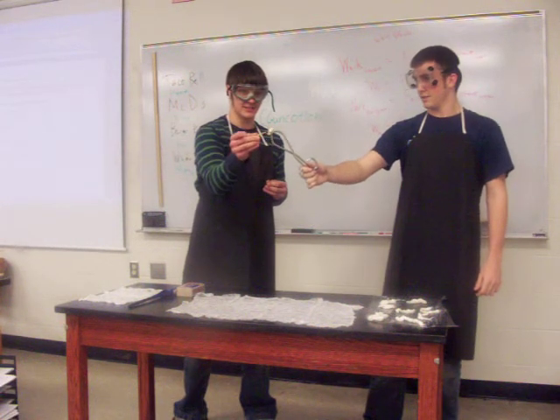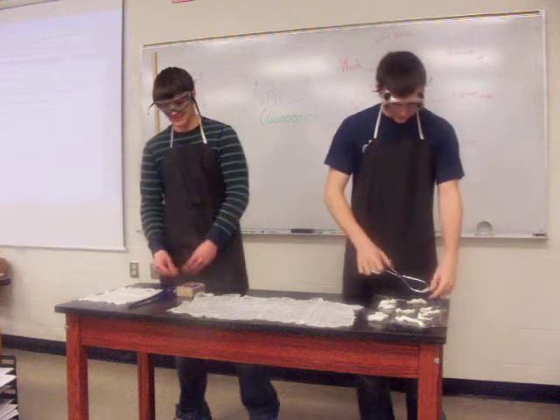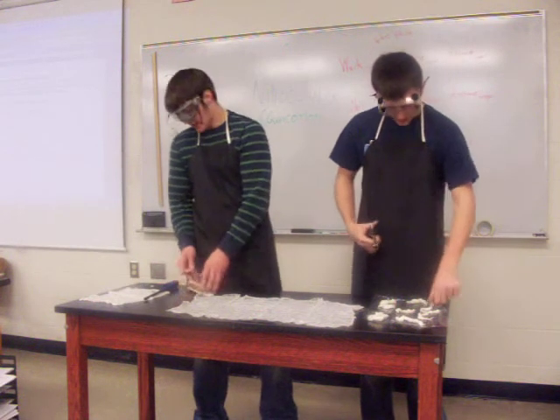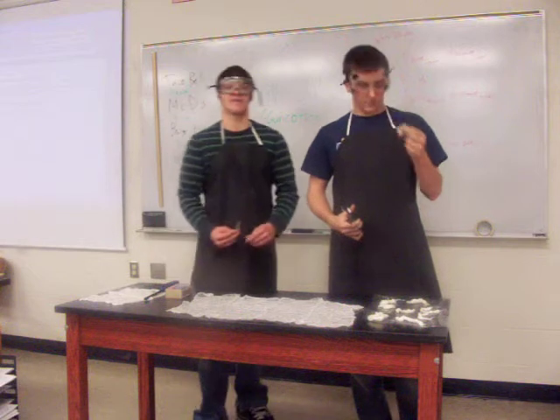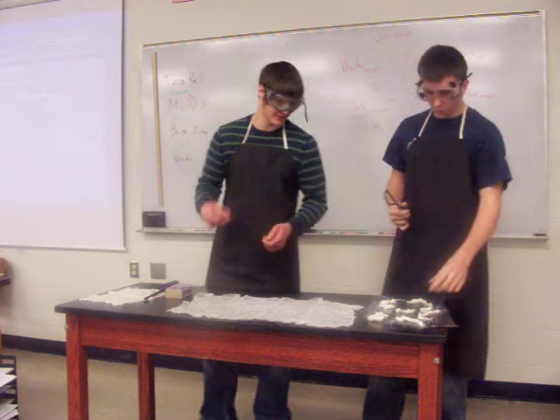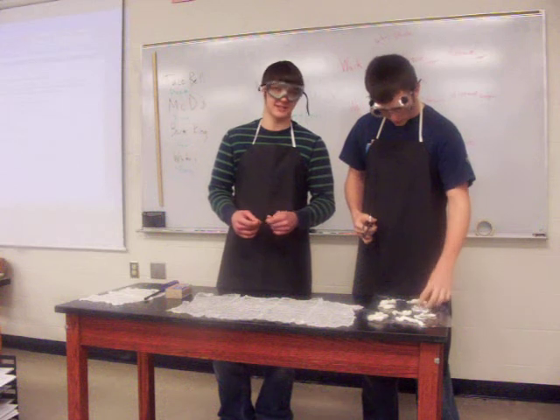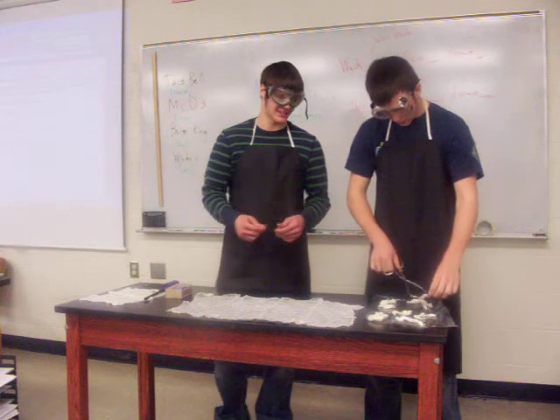Bad one's not good. Bad one. What would cause a dud? It didn't dry. If it's not dry enough, then it's got too much water in it. Or if you don't get enough of the solution, it doesn't have enough acid. Yeah. Then you get duds, like so.